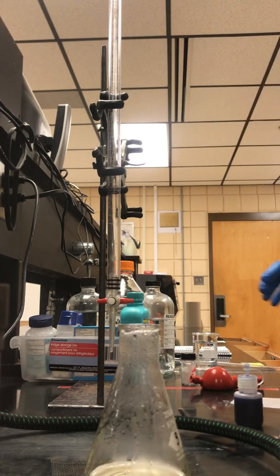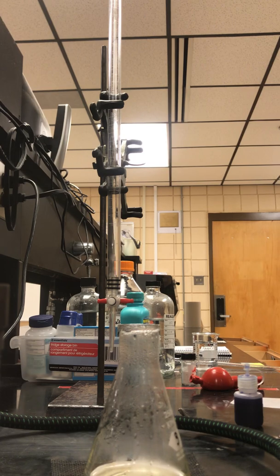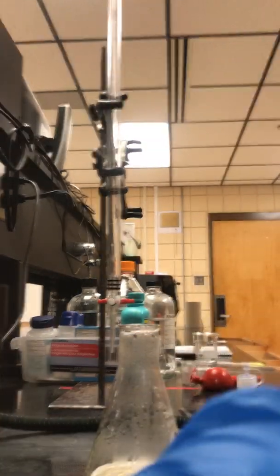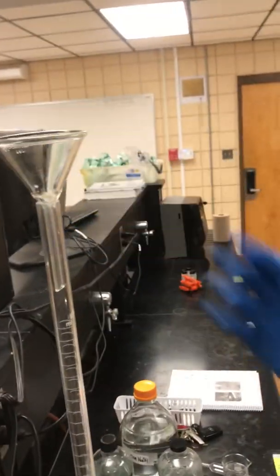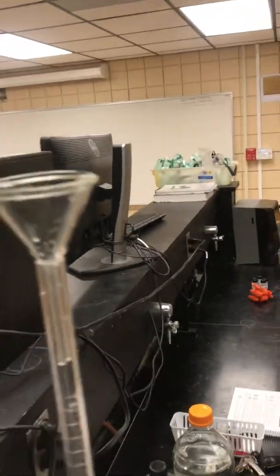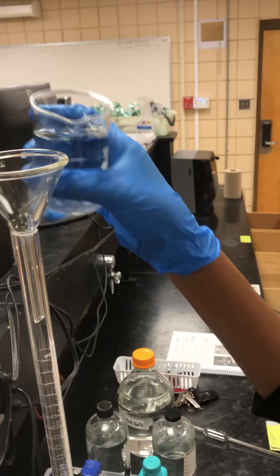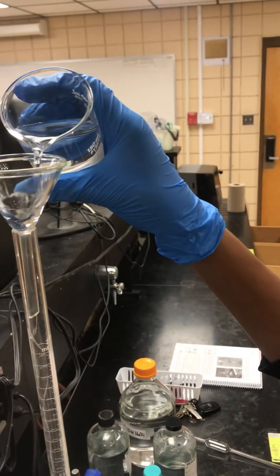The directions tell you how to rinse. I'm going to show you how to fill the burette. Take a funnel and put it at the top. Remember I told you to close the stopcock so it doesn't drip out. Pour in your sodium hydroxide.